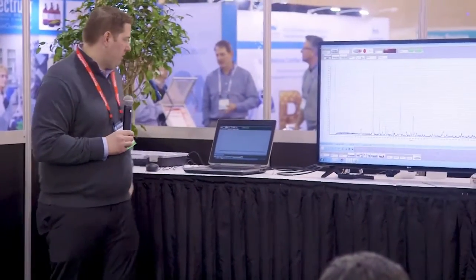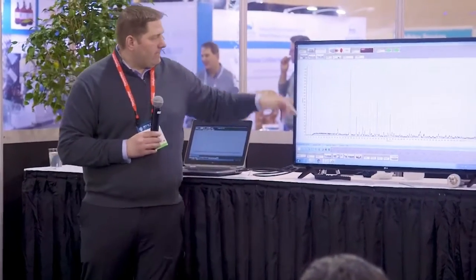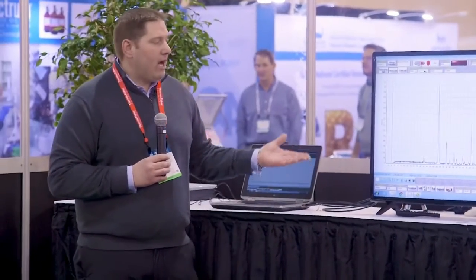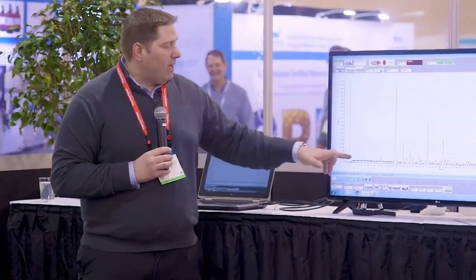And you can see we get simultaneous diffraction across the entire spectrum. And right now we're at a 10-second acquisition. I could stop now if I wanted to. How long you measure depends on how well diffracting your sample is. The key is to get a good ratio between your peak and background. So if you have a good diffracting sample, that could be in seconds. If you have something that has a higher amorphous content or doesn't diffract so well, then you may have to go to 3 to 4 minutes of acquisition.